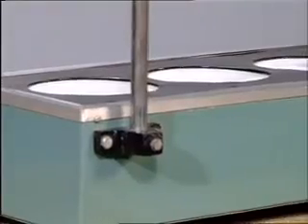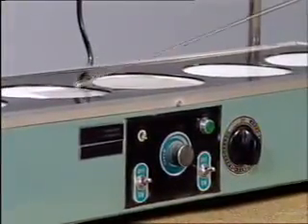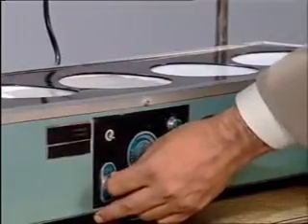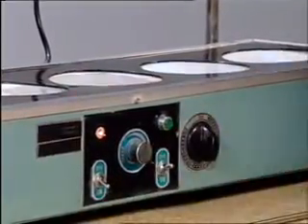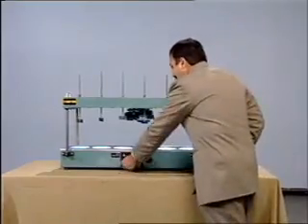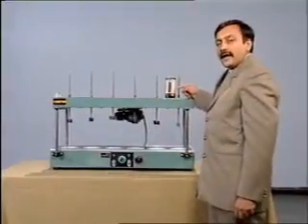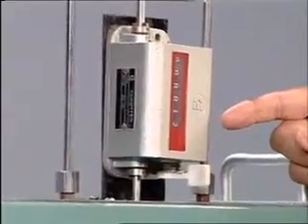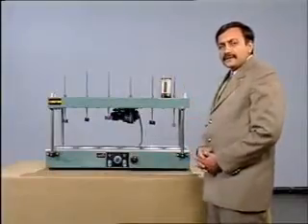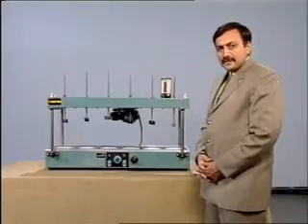The base of the metal housing is provided with a transparent sheet that can be illuminated by a tube light. At the top we have a counter that measures the number of rotations. This is helpful in measuring the speed.